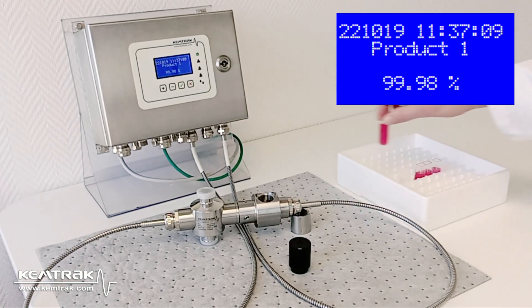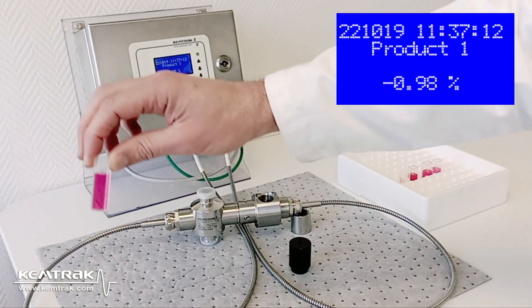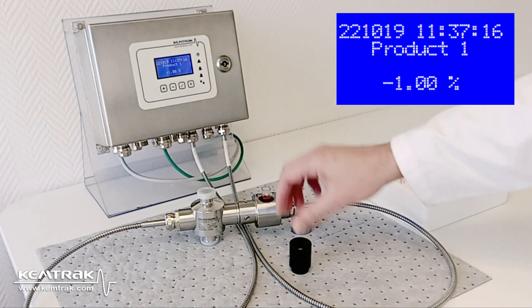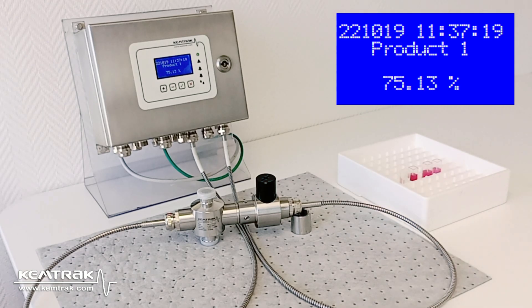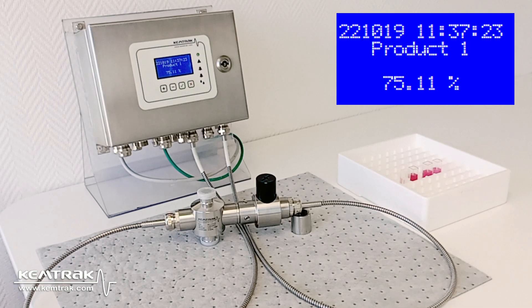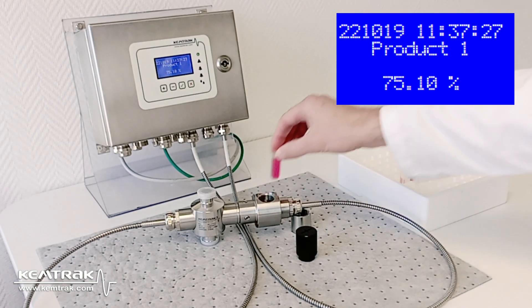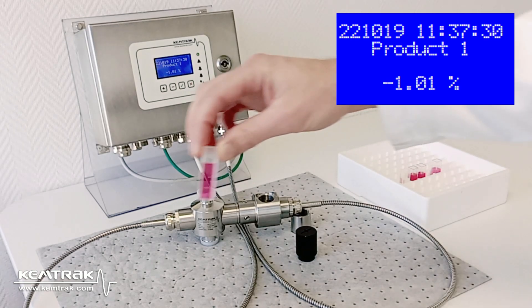Finally, I validate the instrument using my solutions at 75, 50, and 25% concentration. One should always validate after a calibration in order to make sure that it went well. Here we have the solution at 75%, and here, the solution at 50%.